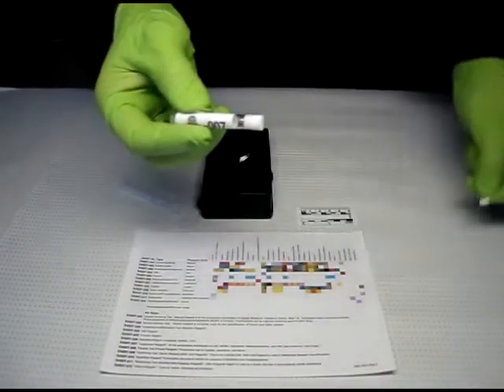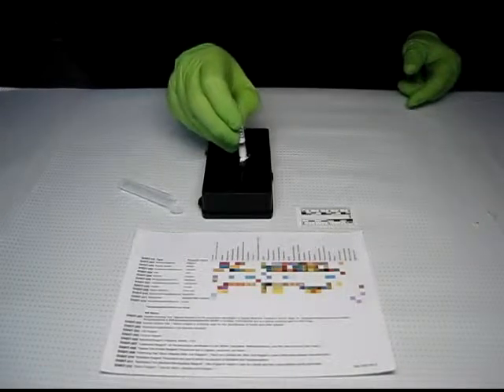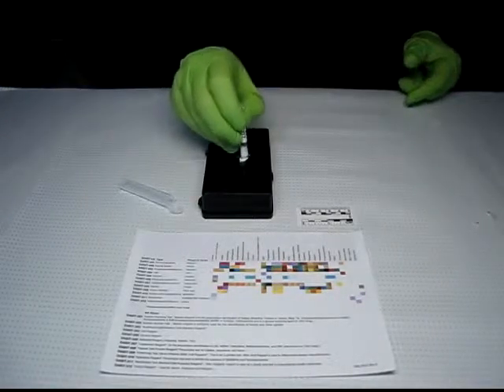Dab the sticky sampler tip on the material to be tested. Replace the sampler into the clear outer tube tip first. Close the cap.